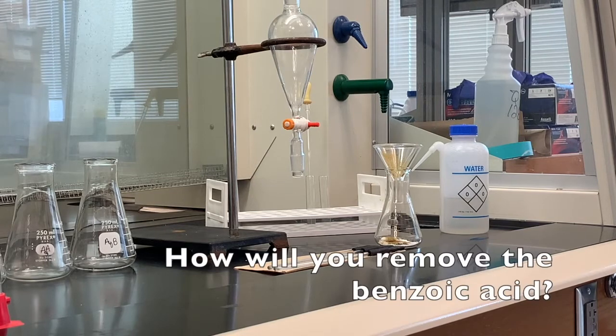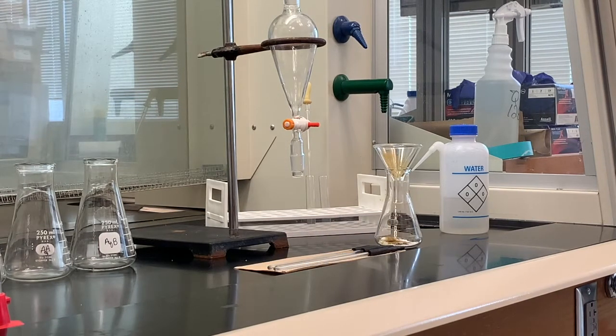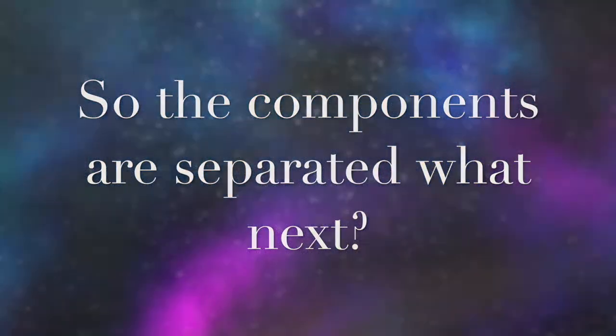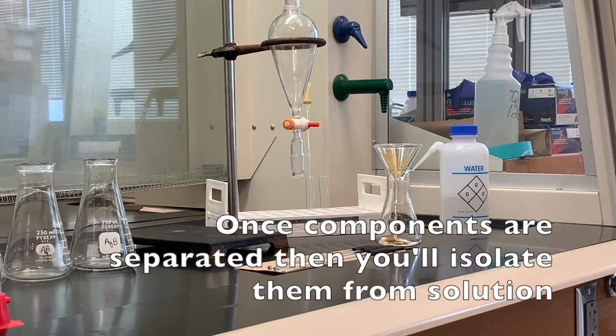How do we remove the benzoic acid? It is an acid. Acids love to react with bases, so we can add a sodium hydroxide solution, and then the benzoic acid would leave the organic layer because it would much rather react with that sodium hydroxide than stay within the organic layer. So once we separate them in different solutions, we'll have to go back and isolate them from those solutions, and that's a step-by-step procedure that we'll go through as we get to that point.